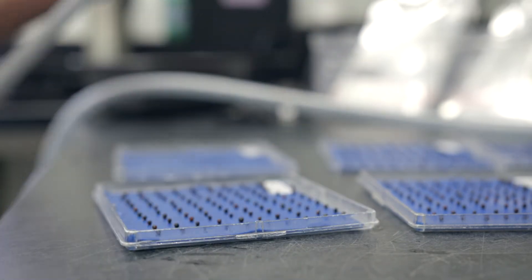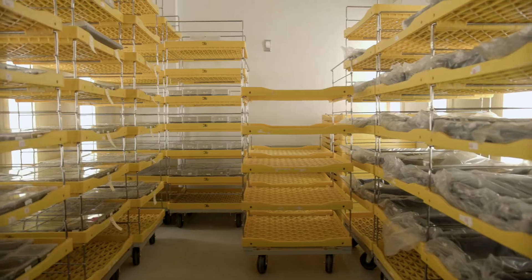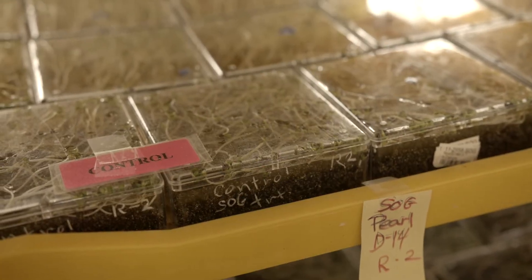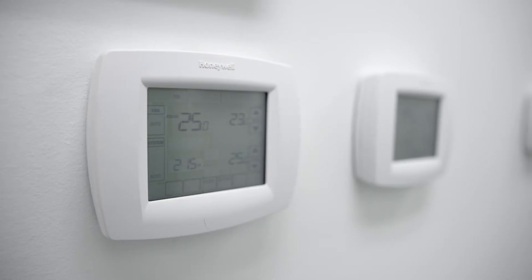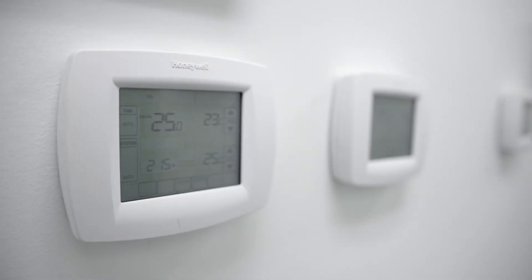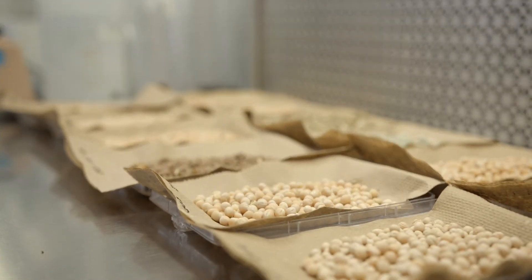Canadian germination requires testing of 200 seeds in ideal conditions in the growth chamber to ensure optimal germination, as there is no stress imposed on the seed. All variables, such as light, moisture and temperature, are strictly controlled to ensure the only variable is the seed itself.